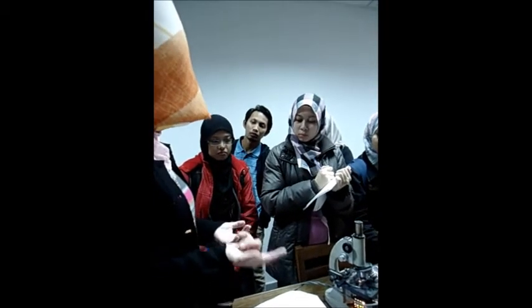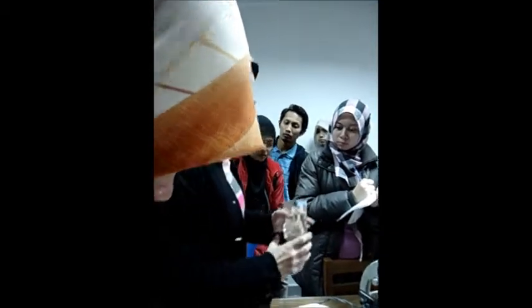Now we know that by definition, a benign tumor is a tumor that is encapsulated, right? But some of them are not. Is a squamous papilloma capsulated? No, it is not. Okay, right. Let's go on to another benign jar. This is very easy. We have a lot of pictures, a lot of different types of it in the museum.